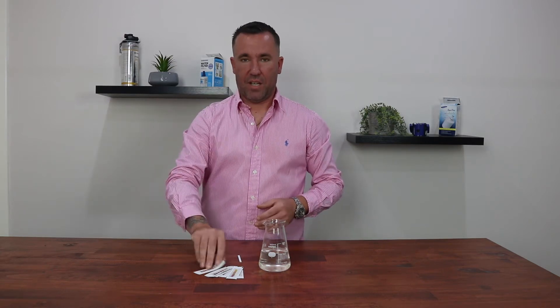Hi, Cameron here and today I'd like to share with you how you can test your water hardness using our total hardness test strips.